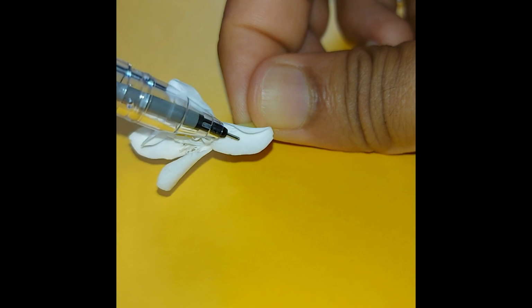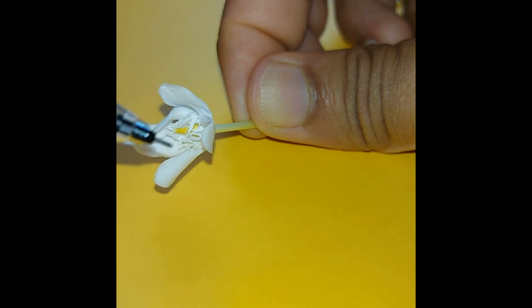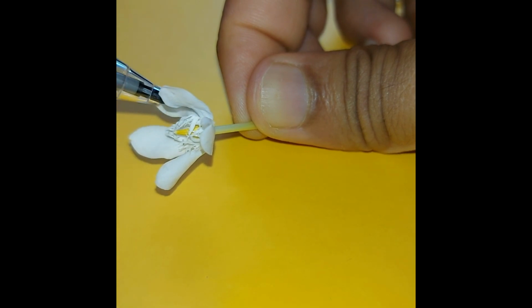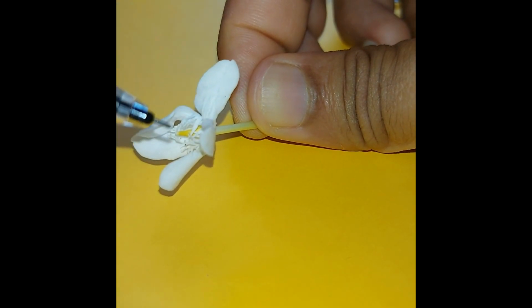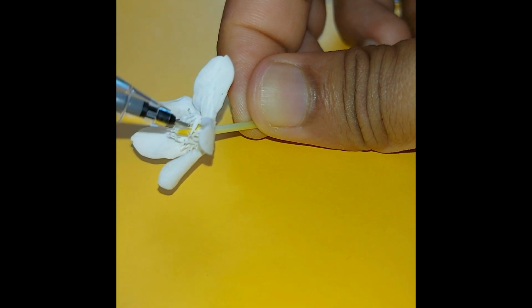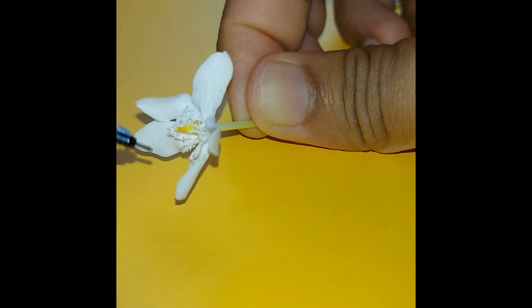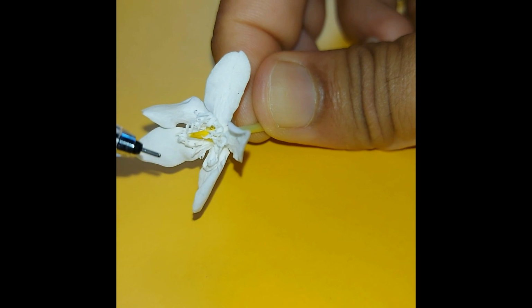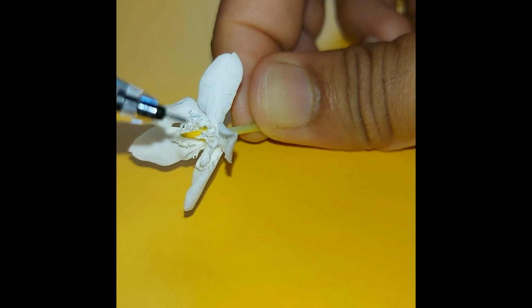Now the internal structure of it is the one that looks so feathery like this. This is also a form of petals that the flower designed itself, so that whatever vectors are coming in will have to somehow touch the anther. Now if you are wondering which is the anther, it is the yellow portion here. Okay, now this flower is not fully bloomed yet, that is why the anther is not widespread and you can't see the pollen itself. Okay, so now this flower emanates a very fragrant scent.